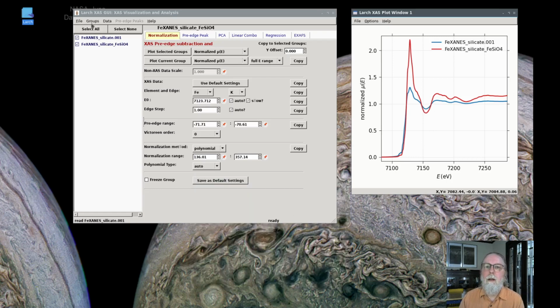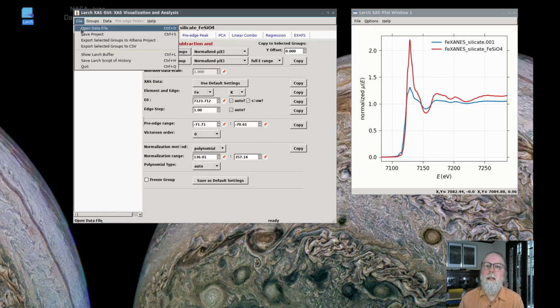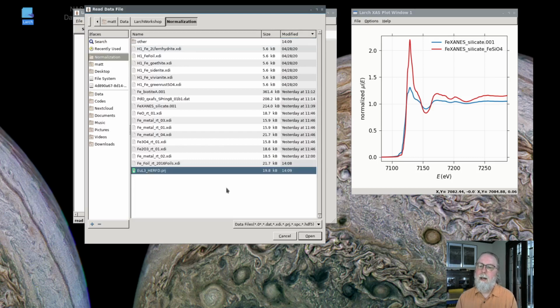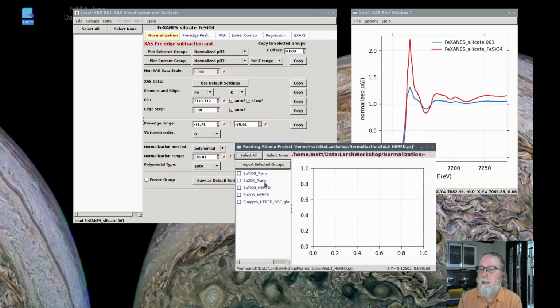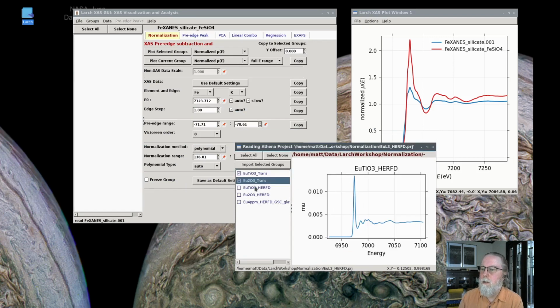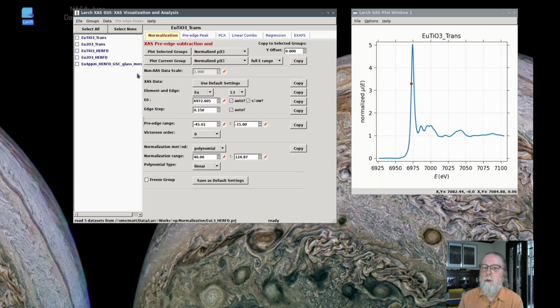Okay, so moving on, we have one more kind of correction or one more sort of processing that you can do with data. I'm going to show you one last semi-correction, and that is, I'm going to read in data from an Athena project file. Here I have an Athena project file with some data collected in HERFD as well as transmission XAFS on europium. When I read in an Athena project file, you can select which of those data sets to read in, and I have two standards, a 2+ and a 3+ standard measured in transmission and in HERFD at the same time, and then a sample for low concentration europium in a glass. So I'll just import all of those spectra.